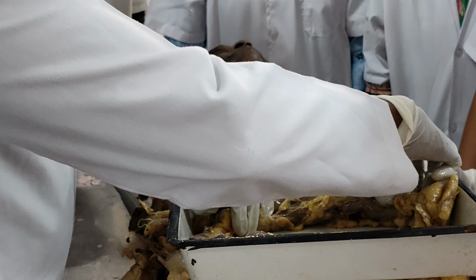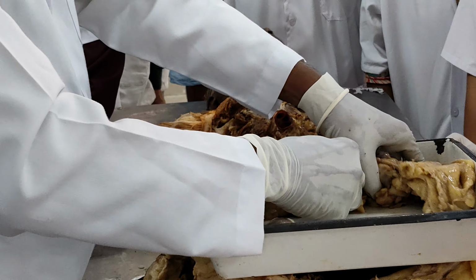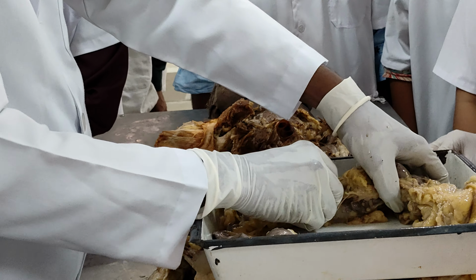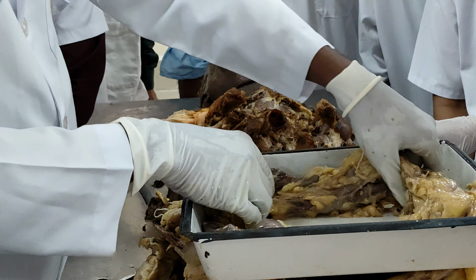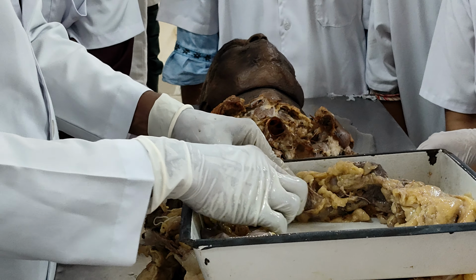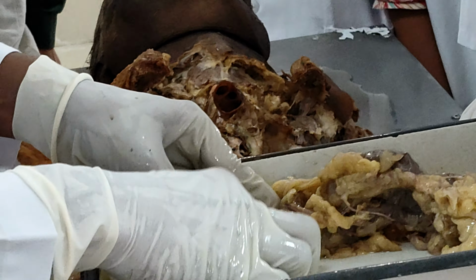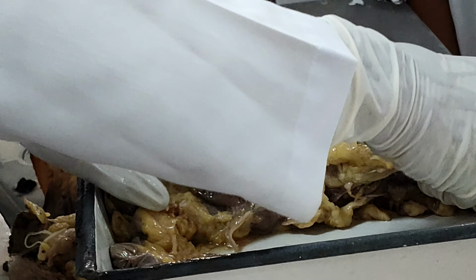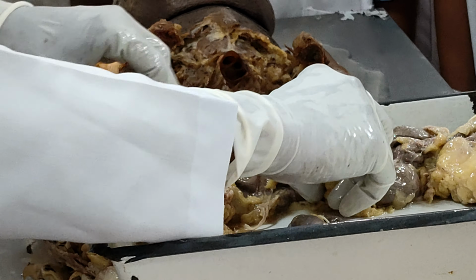And if I take like this on this medial aspect, if I remove the fat on the medial aspect also, here too I can clearly see a faint line here, right? Here it is more visible, right? See, if you touch it, you can see a white line, right? This is the line. So I am keeping it in anatomical position.